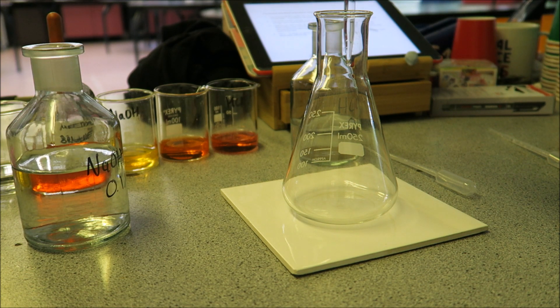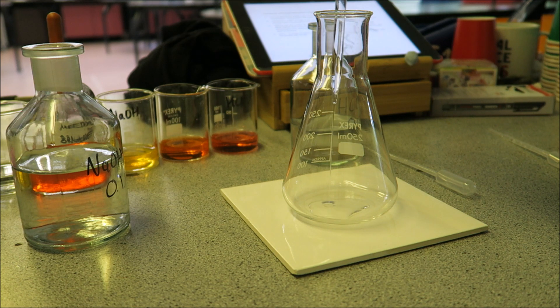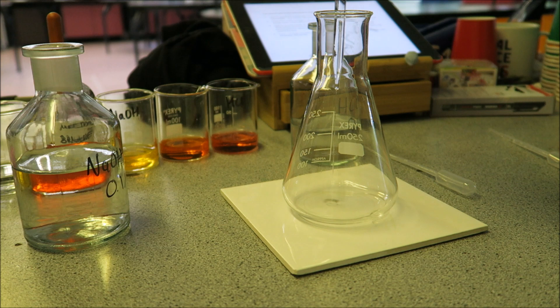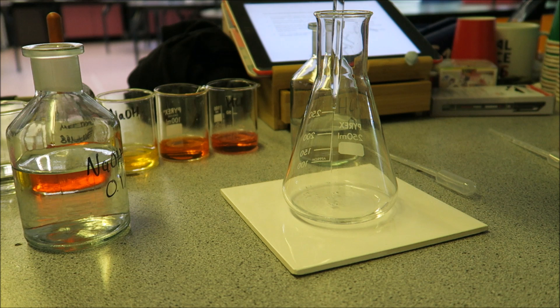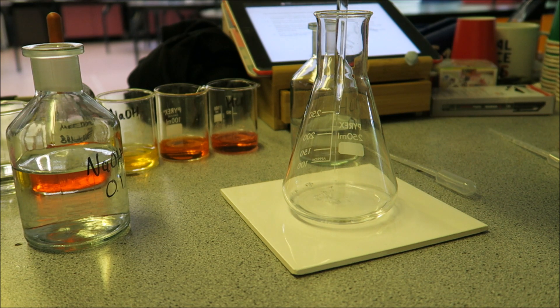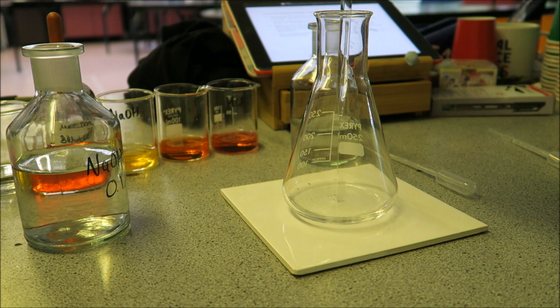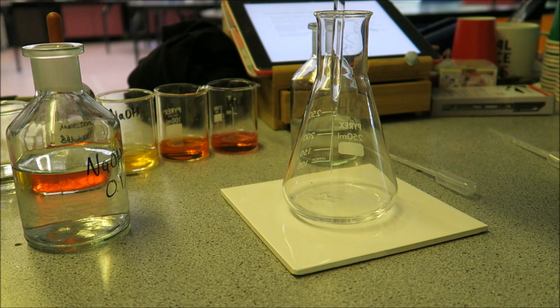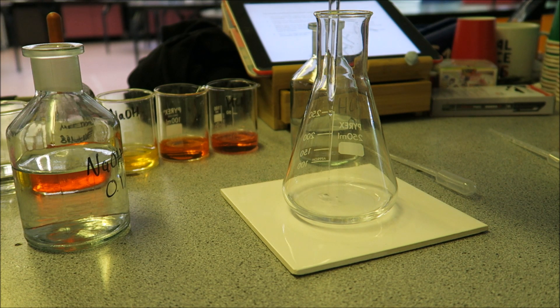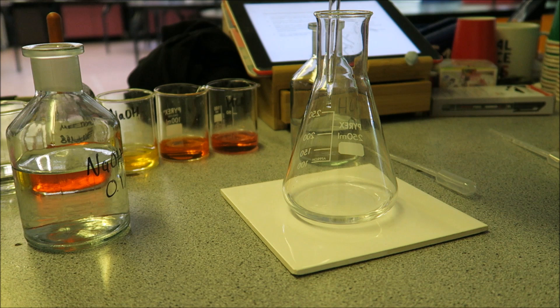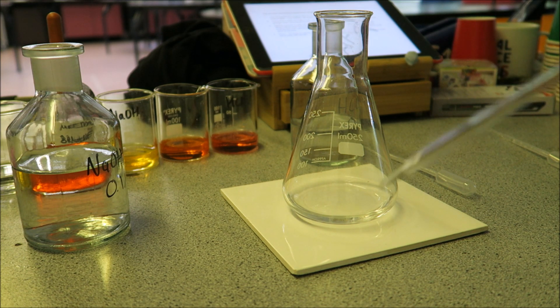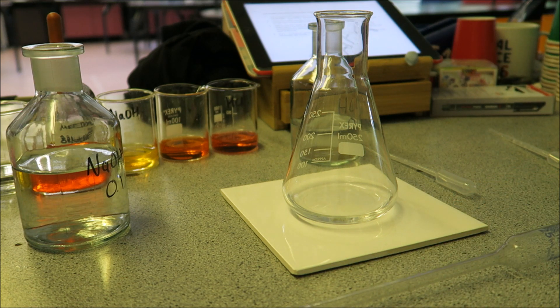Then we are going to need to place our sodium hydroxide into our conical flask. Chemistry is so often about patience, just doing things slowly, patiently, and not rushing. This does take a bit of time to drop out, but that's absolutely fine. Make sure you get every last drop out at the end there. Now we have our sodium hydroxide in our conical flask, so we can start the titration.